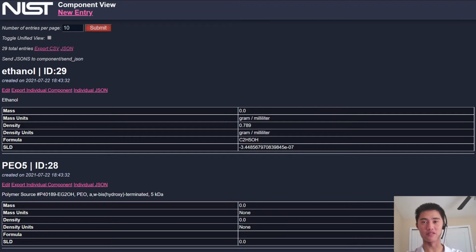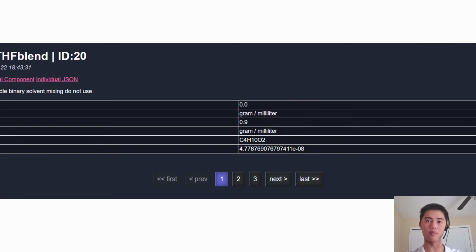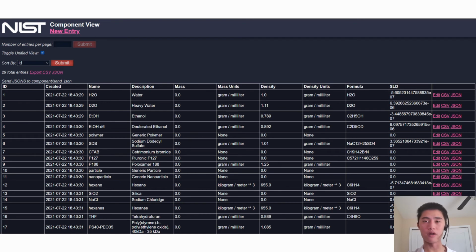Each database table has its own page that allows you to view, create, and update entries. Here's the general view for the component table with real data as an example. By default, the web page displays separate entries for whatever you're viewing, in this format where they are listed separately by name and ID, and further more detailed information is listed below in an individual table. There are buttons for exporting everything to a CSV file, viewing a JSON representation of the data, and editing entries. All of these entries are paged, and you can adjust how many entries are on each page. You can also toggle a unified view exclusive to component that puts all of the information in one table and also gives you some extra filtering options.